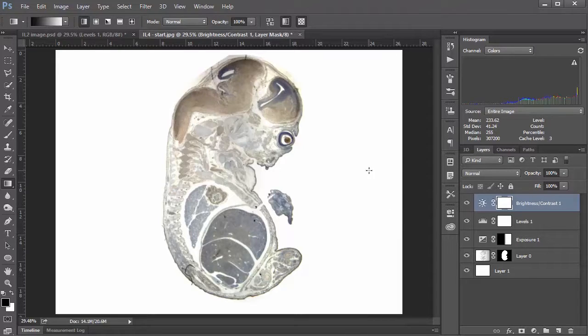So, as I said before, obviously, if you're going to be making these kinds of adjustments, it's kind of a last-ditch effort, and you don't want to start doing your image analysis now. You don't want to be going and poking around and comparing intensity levels between different staining areas, especially, well, mostly because we've done this gradient mask here. And you don't want to be comparing this image to other images that you've taken unless you've done literally the exact same adjustments to all of your other images. Which, if you're going to have to be going through and making these kinds of adjustments to all of your images, you have kind of a problem.